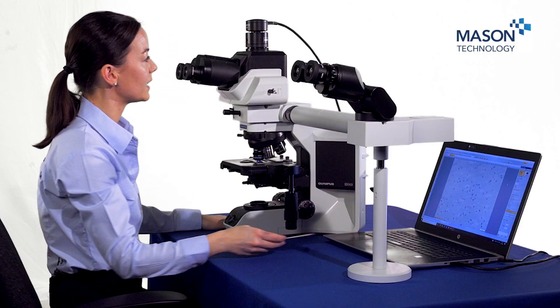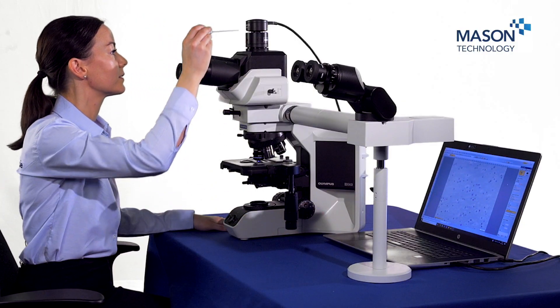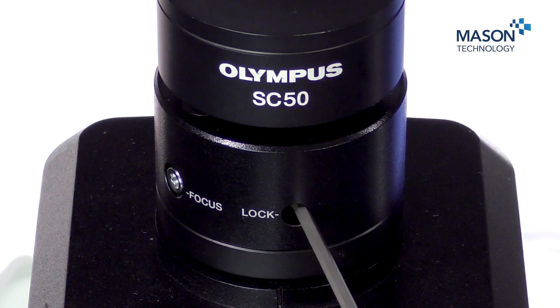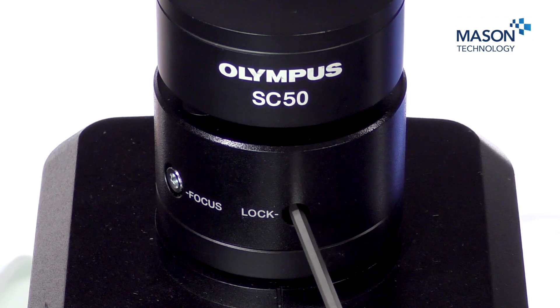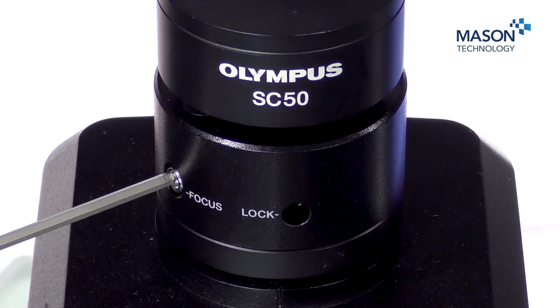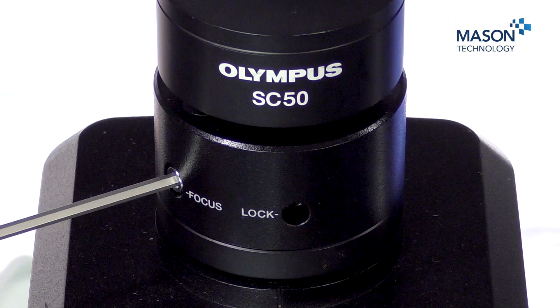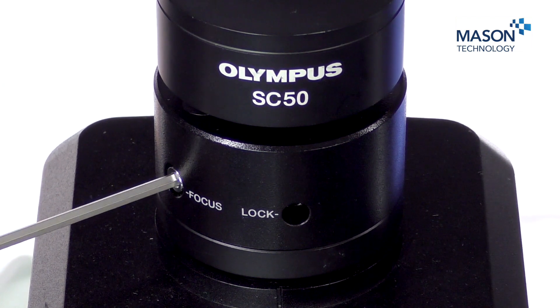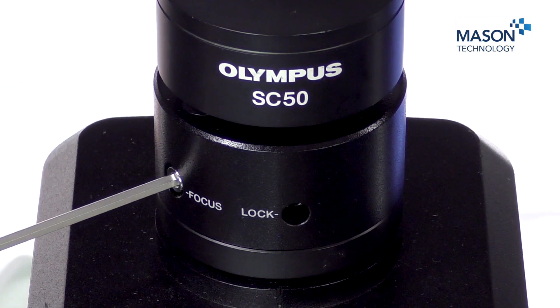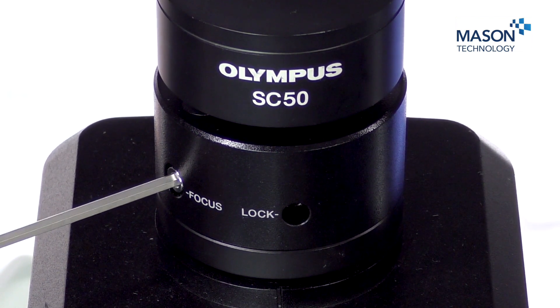The next step is to get your camera in focus. Using the Allen key, unlock your C-mount and place the Allen key into the focus position of the C-mount and bring your image into focus.